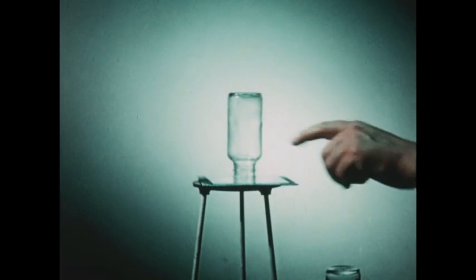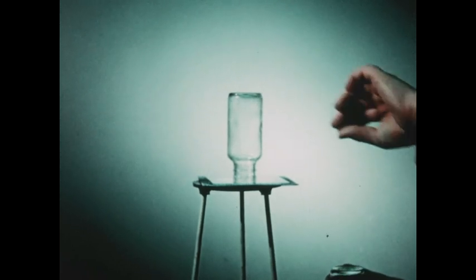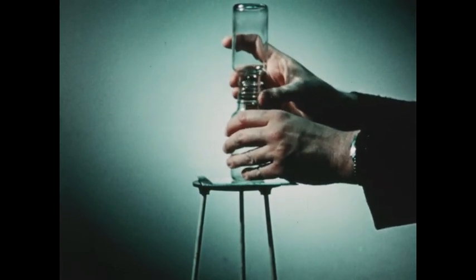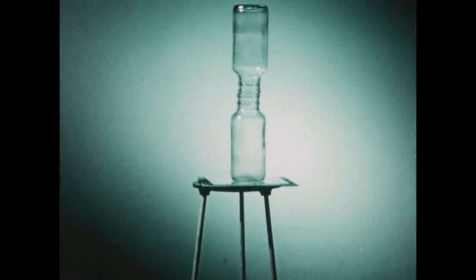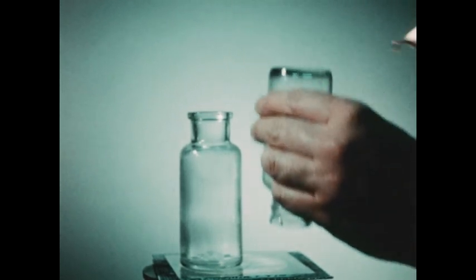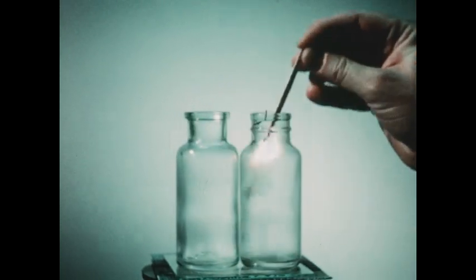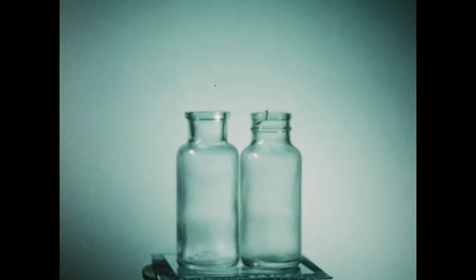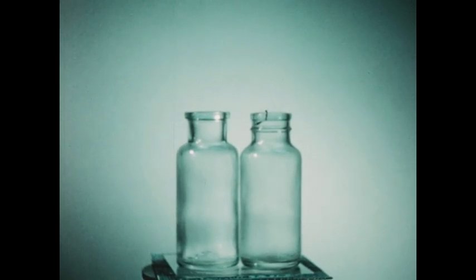The bottle on the stand contains ammonia which we prepared in our generator. In another bottle, I have pure oxygen gas. I'll invert the ammonia bottle and place the bottle of oxygen mouth-to-mouth with it. We'll permit the bottles to stand for several minutes and then attempt to light the mixture. Both times, a puff of flame was obtained, indicating that while ammonia won't burn in air, it will burn in a mixture of ammonia and oxygen. The gases that are produced are water vapor and nitrogen.